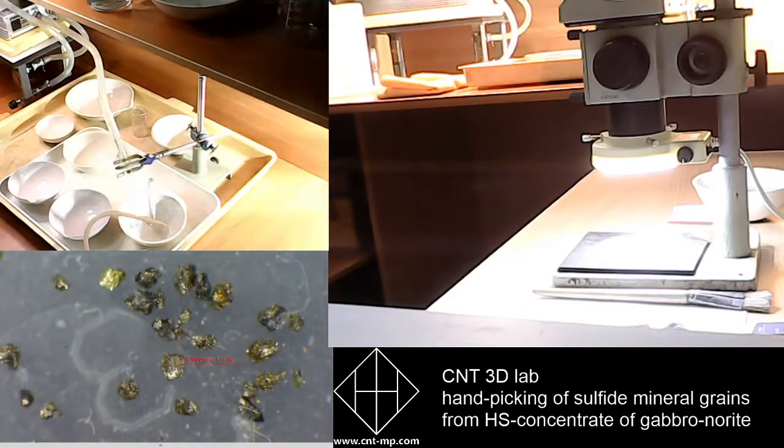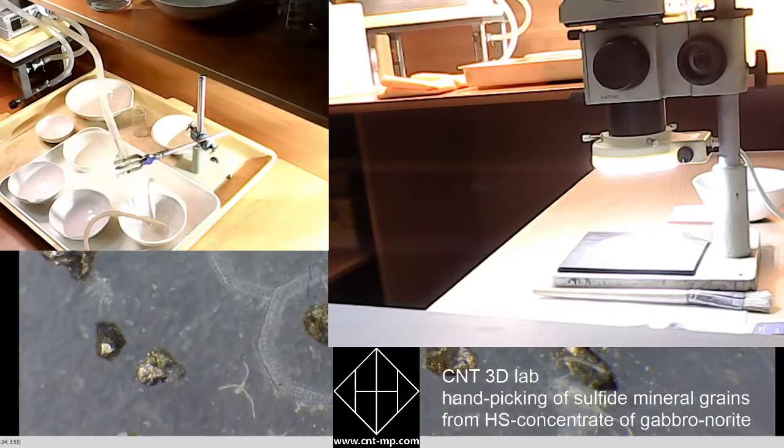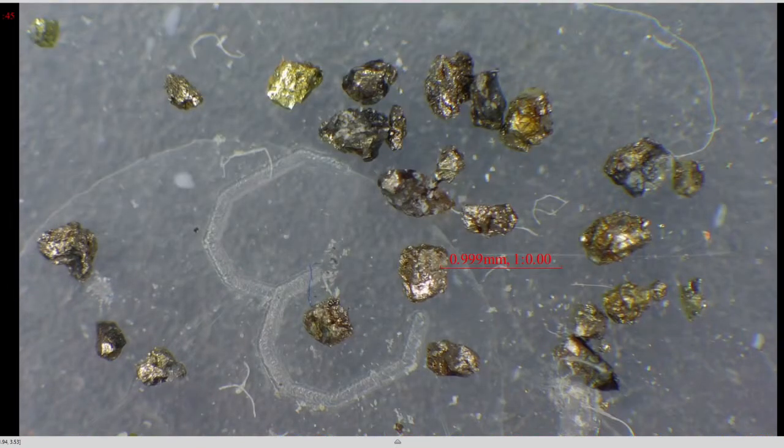There are 40 grains of different sulfide. Let me expand the video. Okay, just a moment.